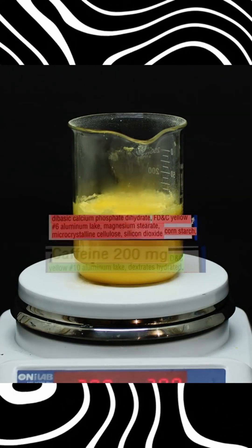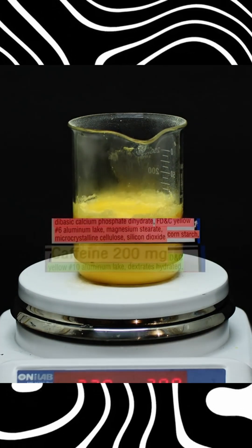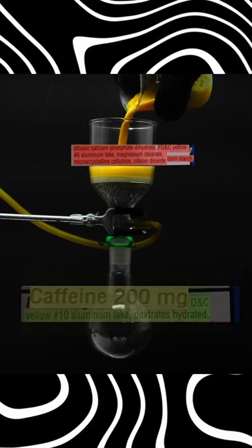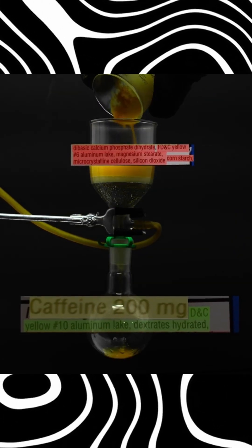So when we add water to the pills, we know that all this red stuff is not going to dissolve and all this caffeine and other stuff is going to. So if we filter it, we separate the caffeine water from all the other stuff.